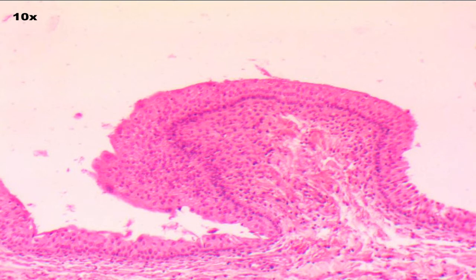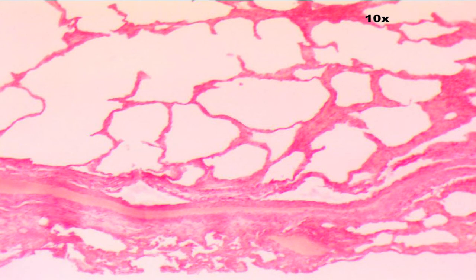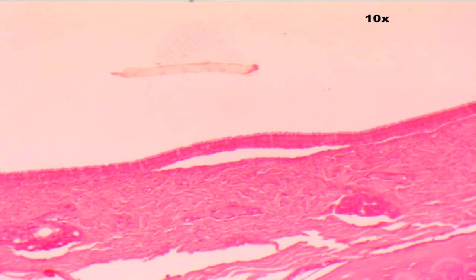So here is slide 1. This is slide 2. This is slide 3. Slide 4. Slide 5. Slide 6. Now remember to pause this video so that you don't see the answers too quickly, because I'm fixing to show you the answers.